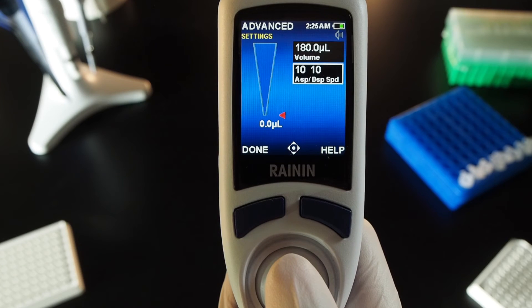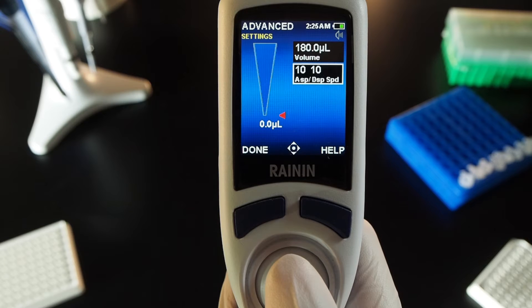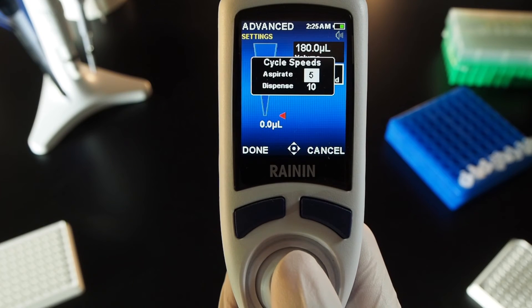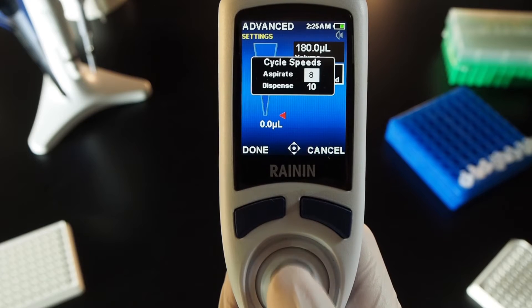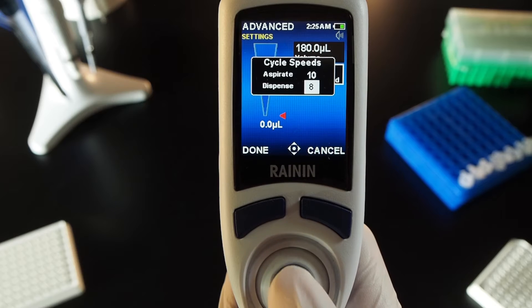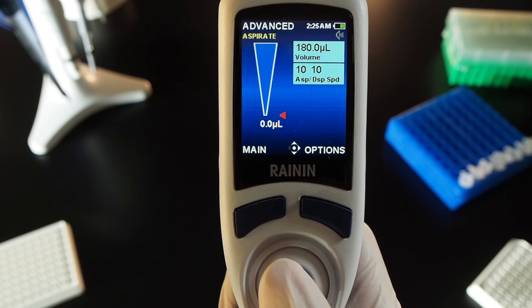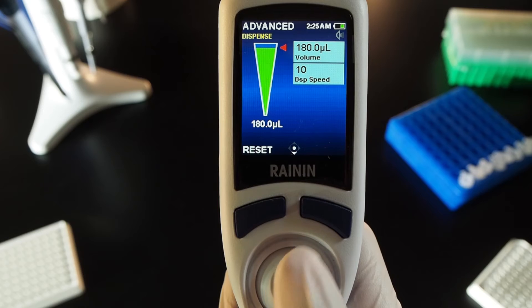Now the aspiration dispense speed box is lit. Press the joystick in to open cycle speeds, and press it again to select and adjust either speed. Left and right decrease or increase the speed by 5. Up and down increase or decrease by 1. To exit, press done. Press done again to exit settings and run the cycle — up to aspirate and down to dispense.